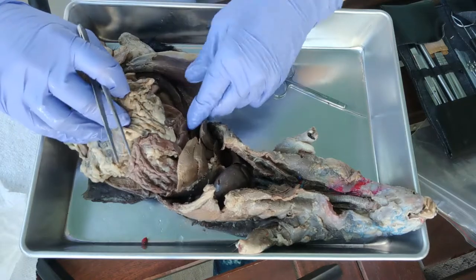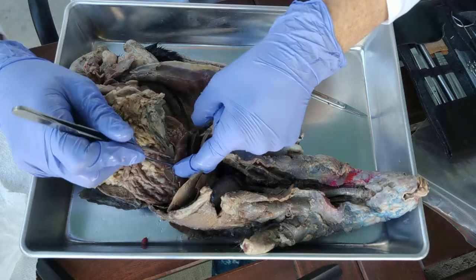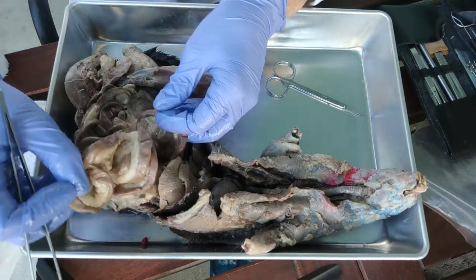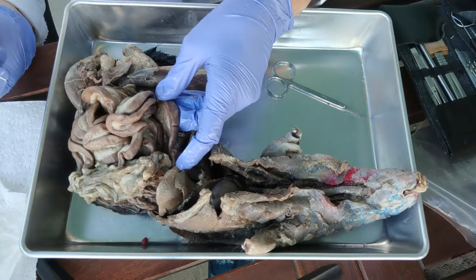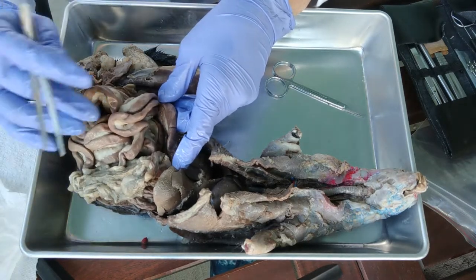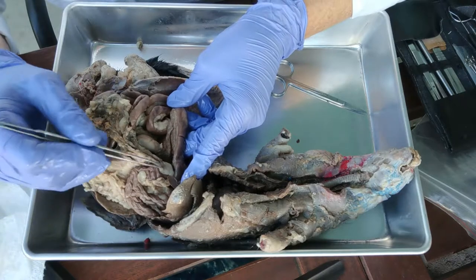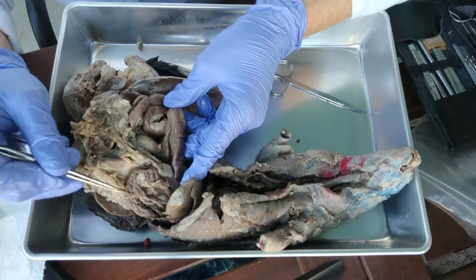Continuing down, the stomach empties into the small intestine. The first part of the small intestine is the duodenum. That becomes the jejunum, and at the very end we have the ileum. You should be able to identify the duodenum because it's the part coming directly out of the stomach.